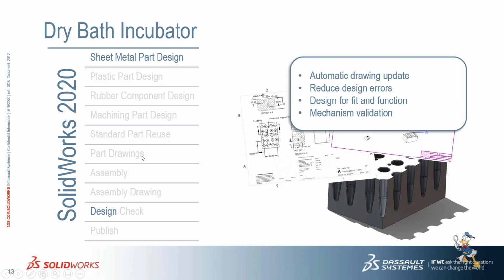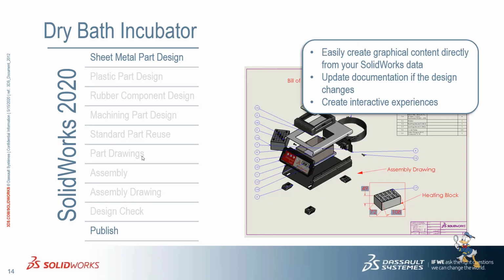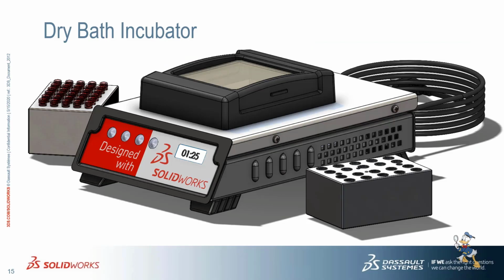After design checking, we just need to publish our drawing. We can publish our drawing in the format of eDrawing, PDF, and 3D PDF are also available for SolidWorks. So this is how we can do designing in SolidWorks by using these kind of design tools. So this is how we design a dry bath incubator in SolidWorks.